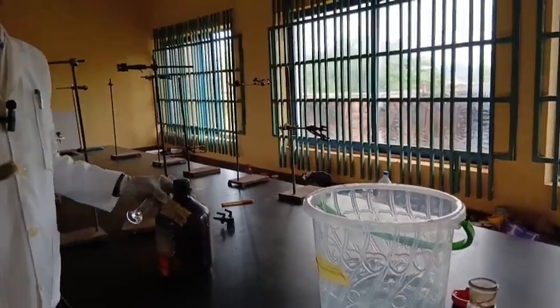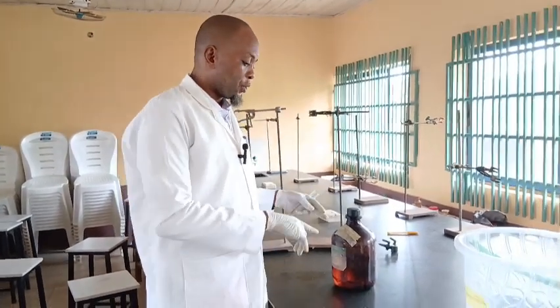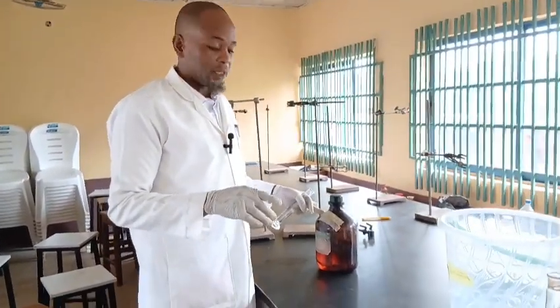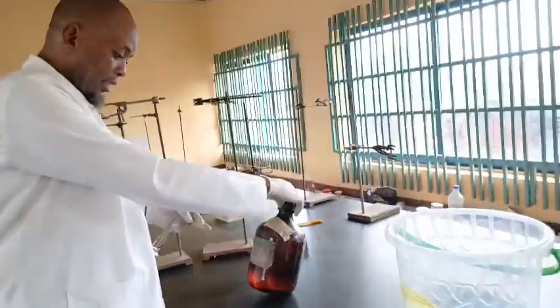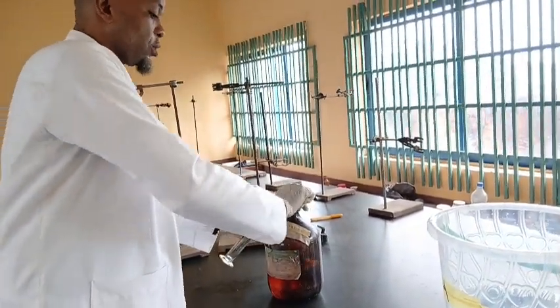As a chemistry teacher, you must be able to calculate the concentration of the acid and know the amount of solvent you are going to use. The solvent in this case is water. We are going to use acid, and this acid is H2SO4, that is tetraoxosulfuric acid. This is the concentrated acid, the stock. So this is from the stock.